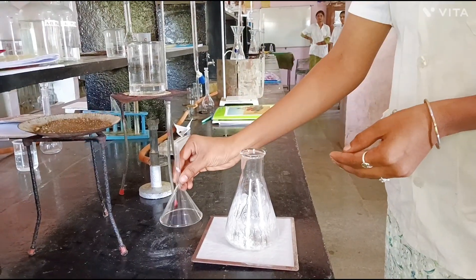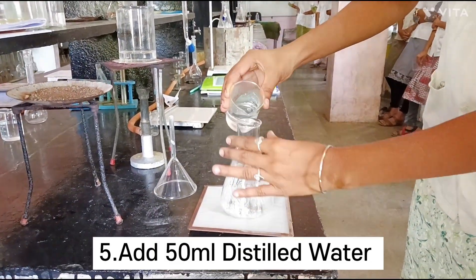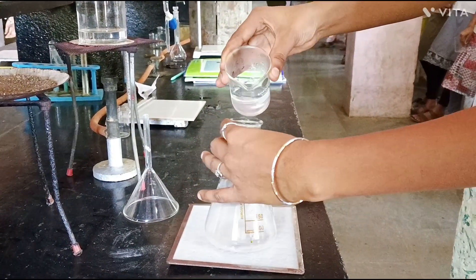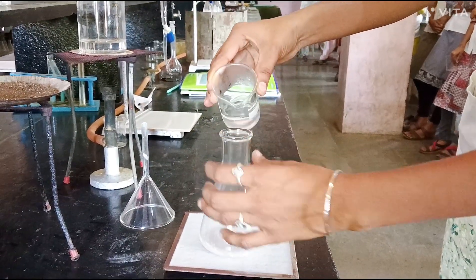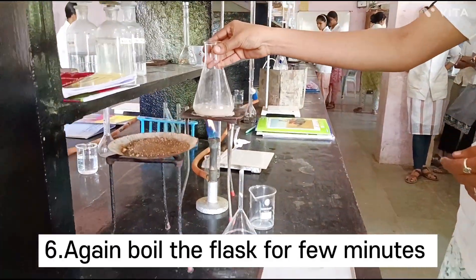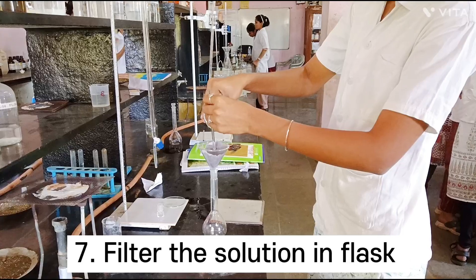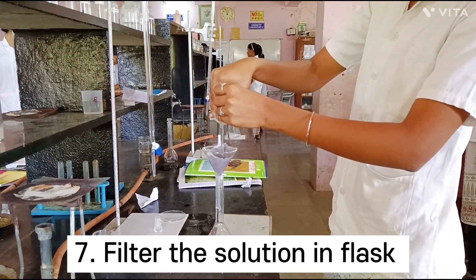Remove the filtration funnel and add 50 ml distilled water to extract magnesium chloride into distilled water. Add the distilled water from the sidewall of the conical flask so that all particles will get dissolved. To extract magnesium chloride, boil the content for 2 minutes. After extraction and cooling, filter the content to remove insoluble matter.